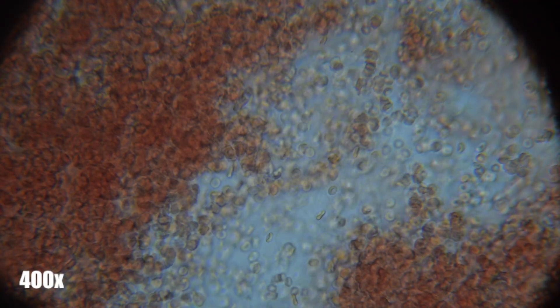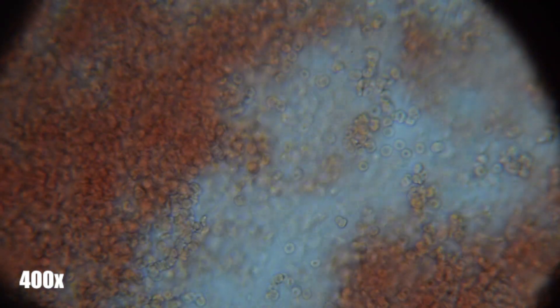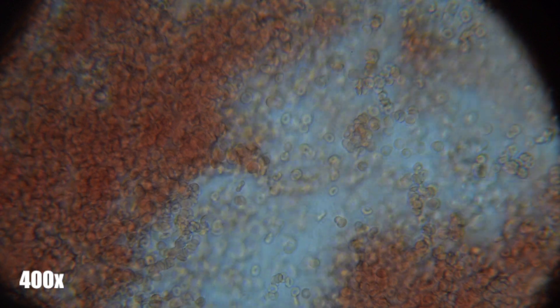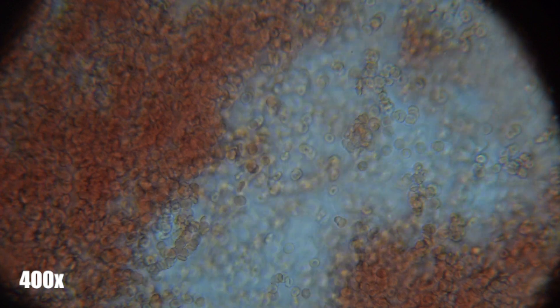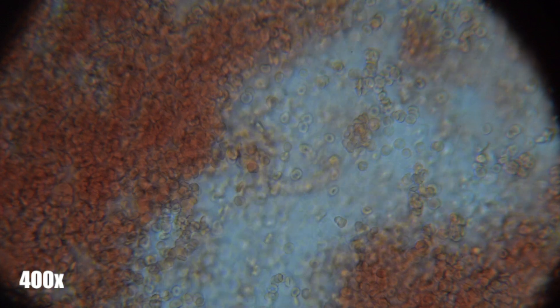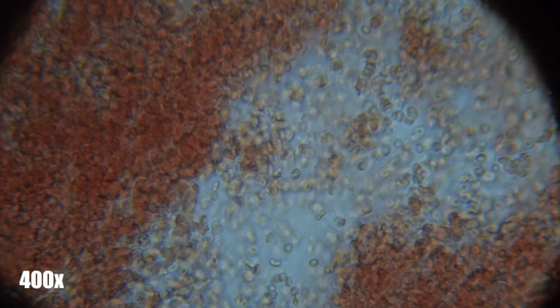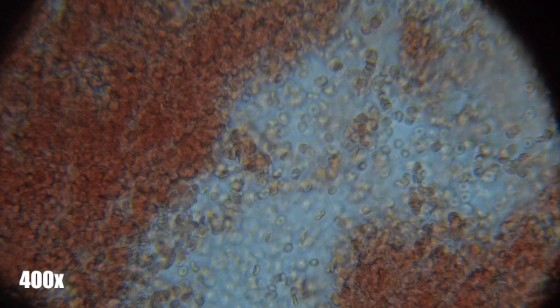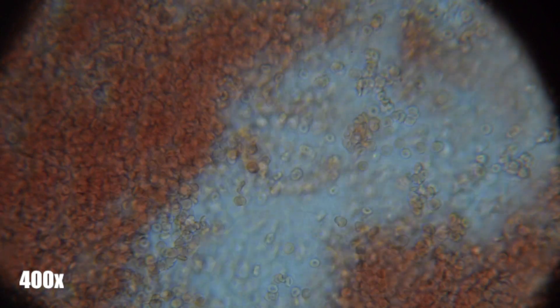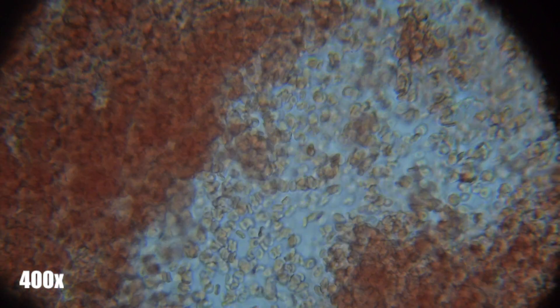These red blood cells are unique, as they actually possess no nucleus. In high school biology, you were always taught the difference between eukaryotes and prokaryotes as having a nucleus, or not having a nucleus, respectively. And also that human cells are eukaryotic. However, human red blood cells are eukaryotic cells without nuclei.